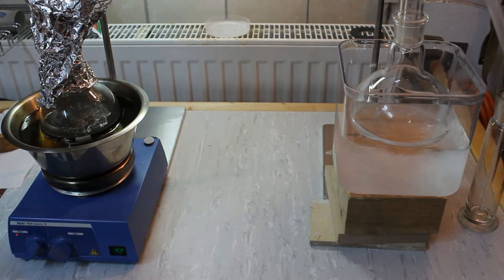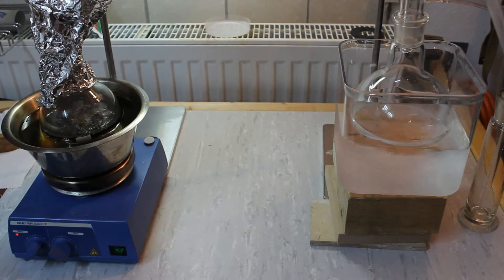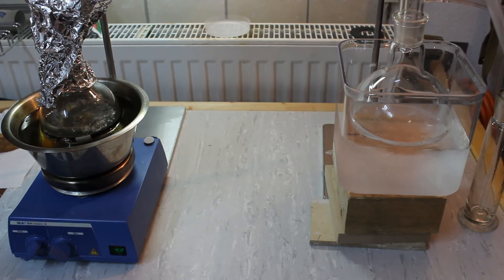We're approaching the end of the distillation. The rate of collection is going down as well as the stillhead temperature is continuously dropping. And once I crank up the heat on the hot plate a little bit gas evolution starts to increase quite a bit.